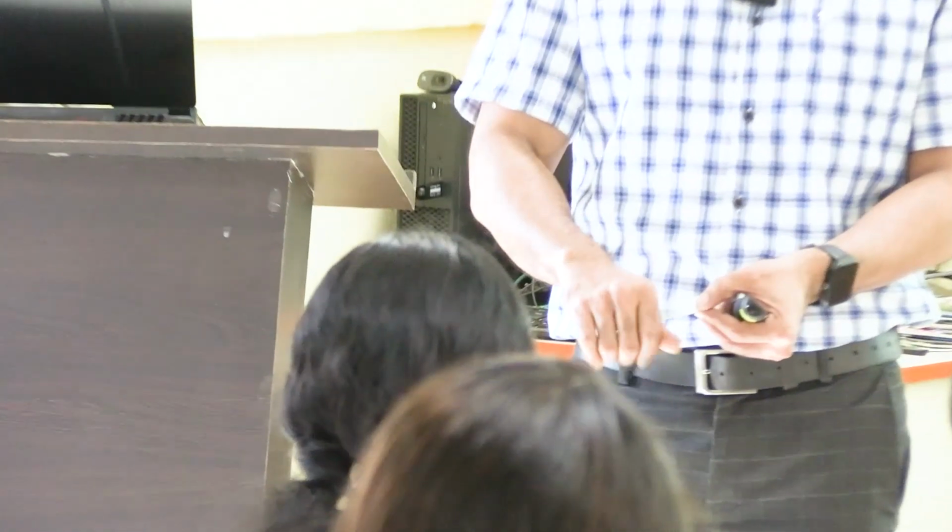Now suppose I cover it like this and put it under the microscope, how will I identify? With the help of the identifying features. That means you have to know about the tissue, then only you can identify. So during the time of exam, this kind of slide will be placed under the microscope. For identification and writing the identifying features, you will be getting only 2 minutes. Within that you have to identify, and at least write 2 to 3 identifying features. Then you have to go to the next slide. That becomes a bit challenging.